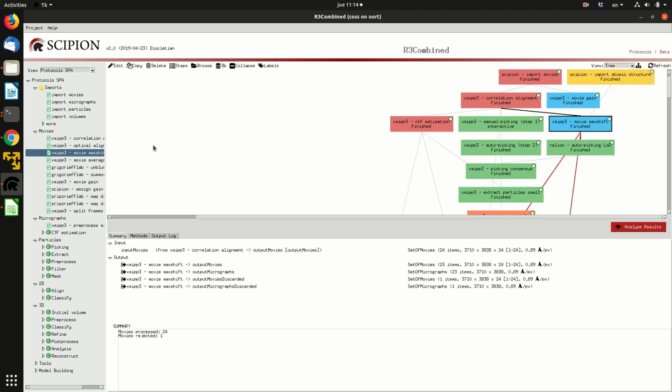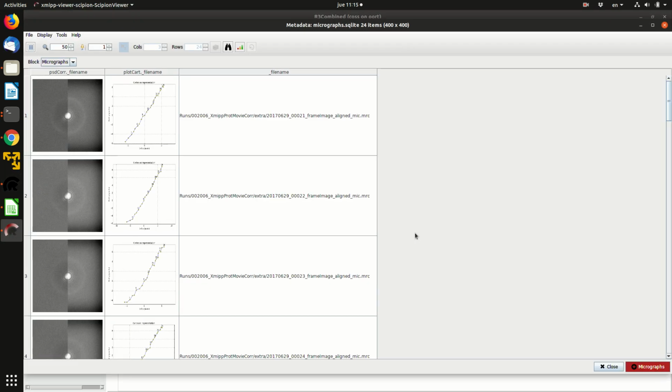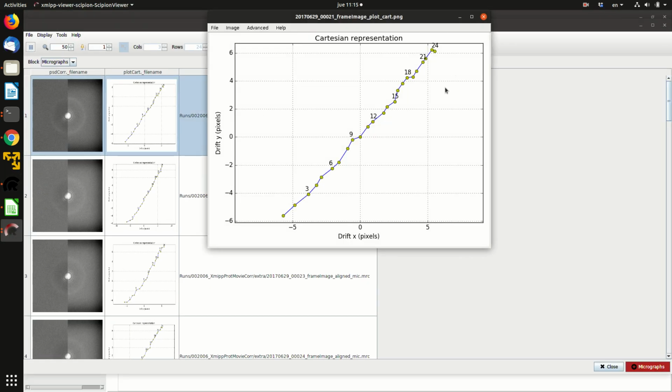So the next tutorial is on the use of movie max shift. So let's say that you have imported some movies, you have aligned them. So this is an example of how this is a summary of the local movement from each frame 1 to frame 2, frame 2 to frame 3.